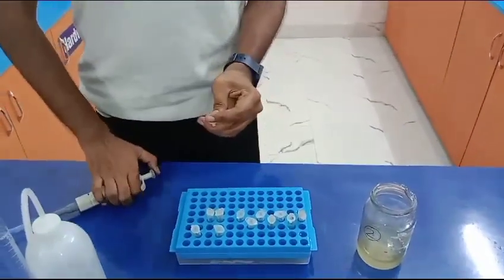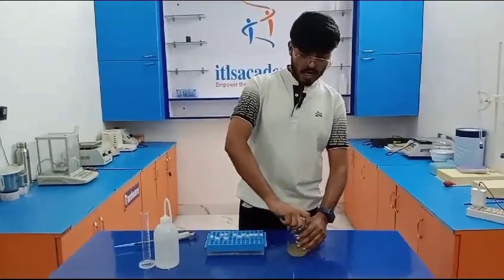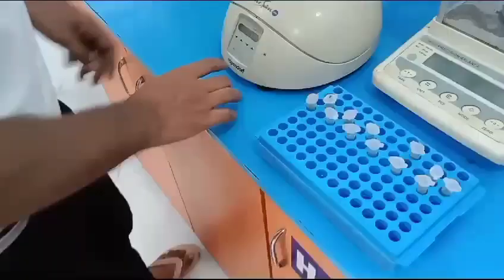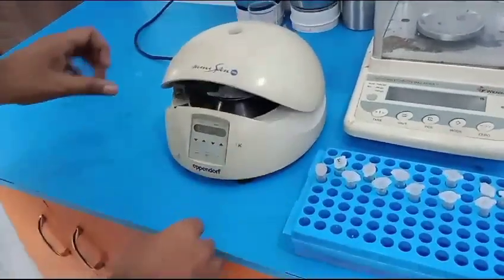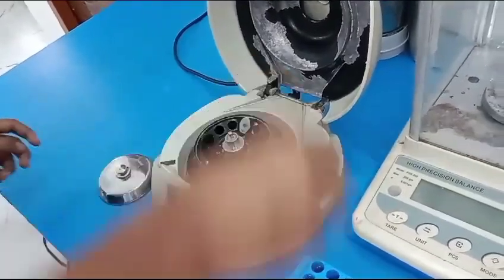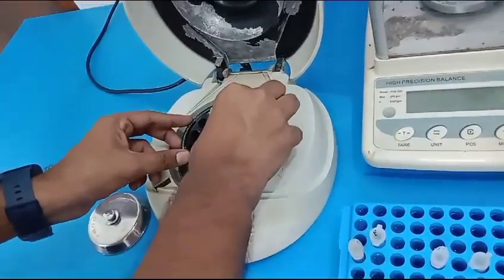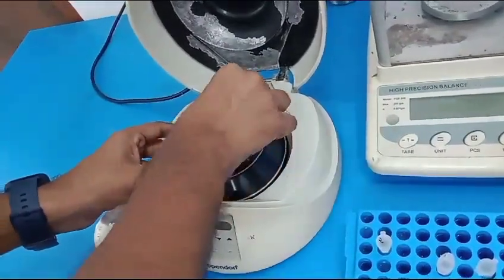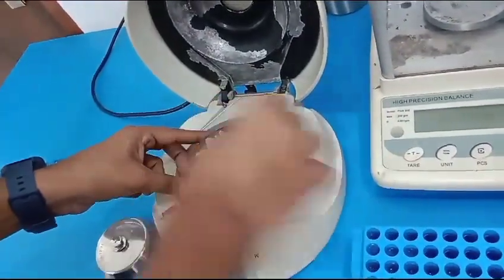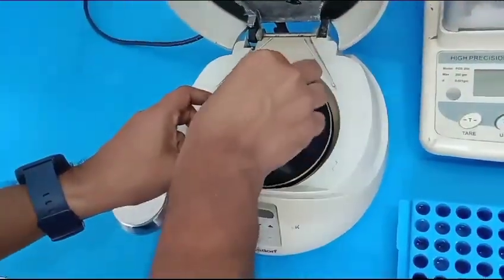After pouring 1 ml of this enzyme into each of the Eppendorf tubes, I am now going to centrifuge for 15 minutes at 6000 rpm. Here I am putting the Eppendorf tubes into the centrifuge — we need to balance it.